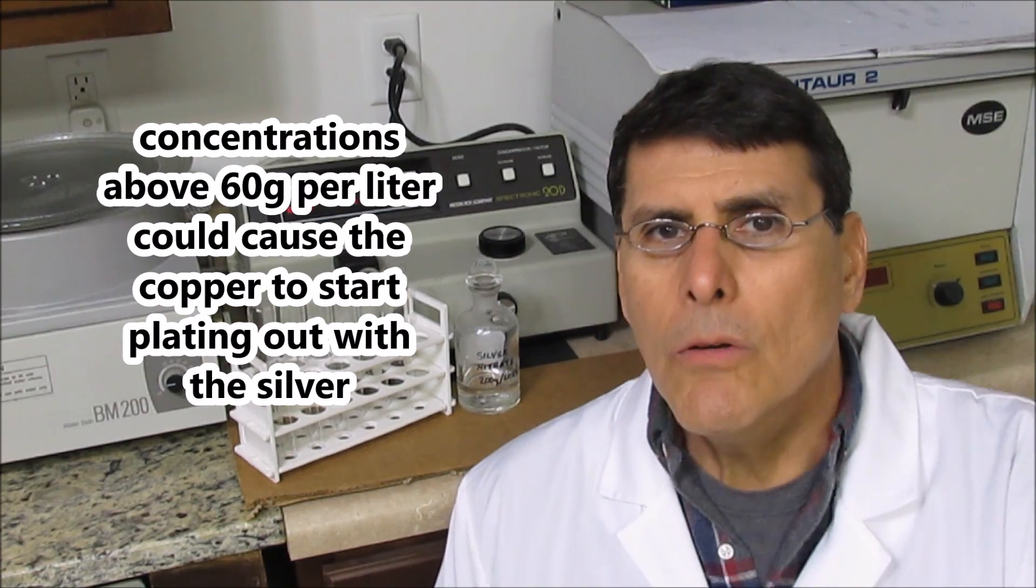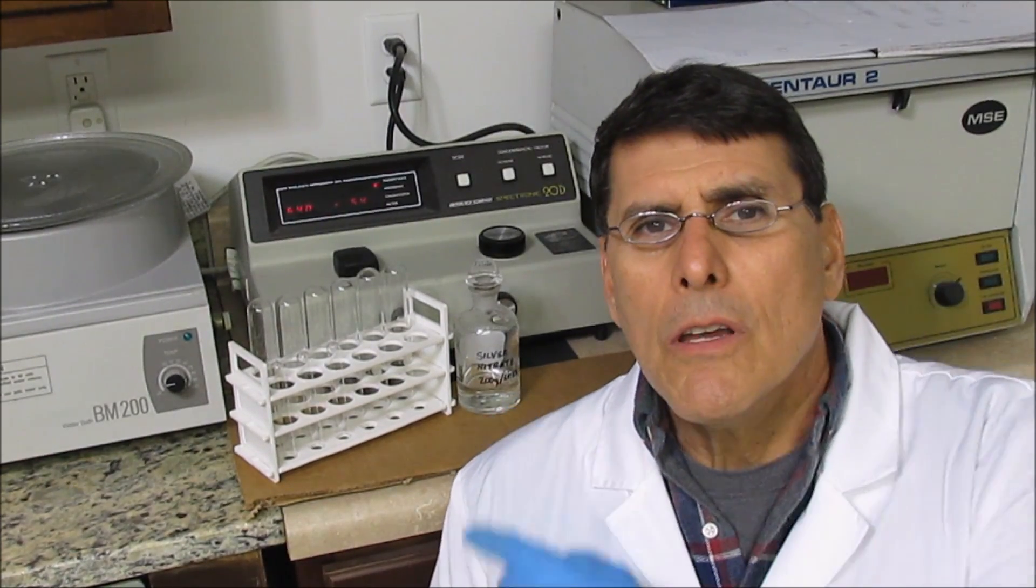So I'm going to use my spectrophotometer to determine the amount of dissolved copper in this electrolyte to see if I can use it for another refining.